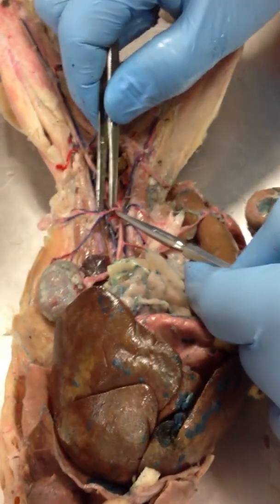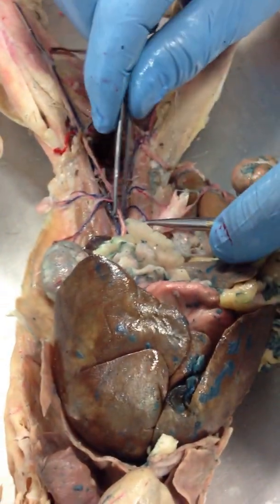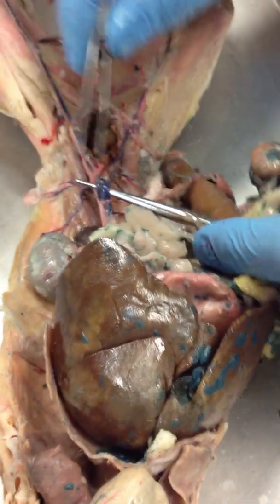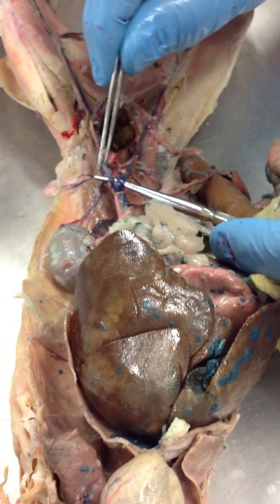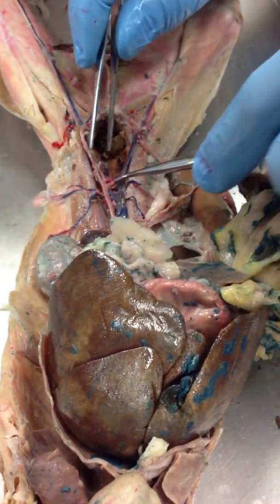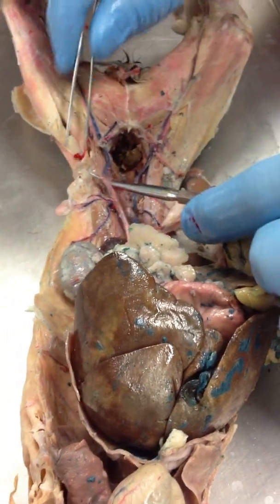This is our adrenal lumbar vein. Where the post-cava branches its first branch — these two — this is left common iliac vein and right common iliac vein.